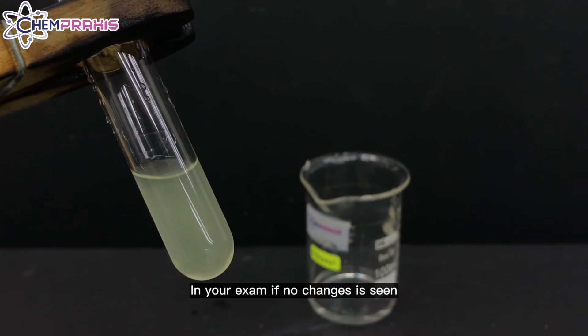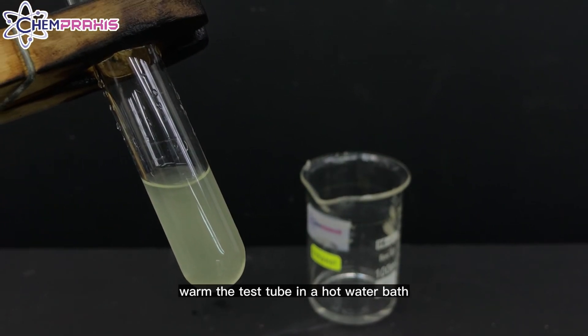In your exam, if no changes are seen, warm the test tube in a hot water bath.